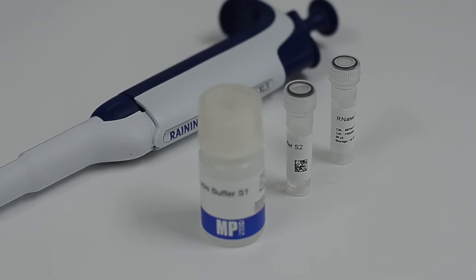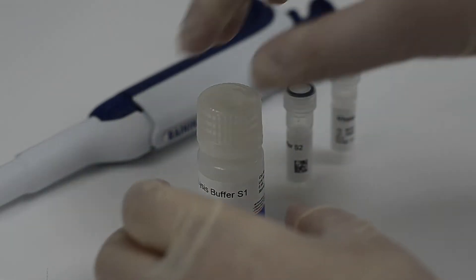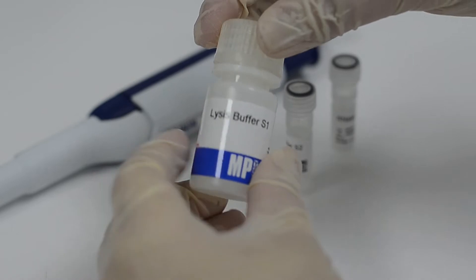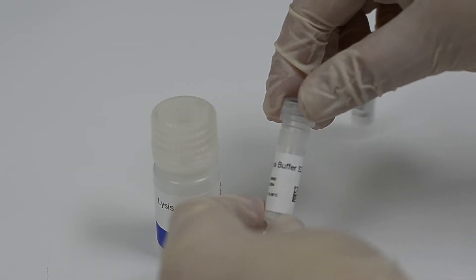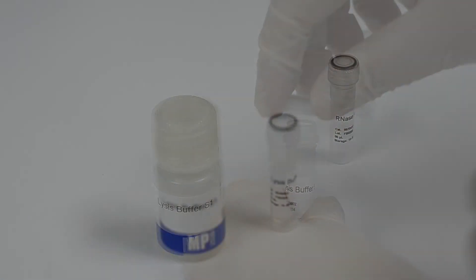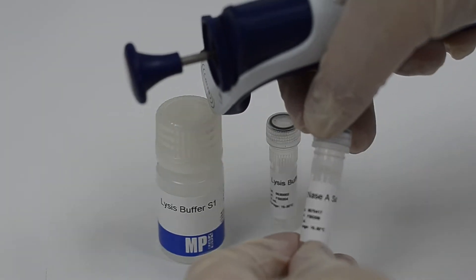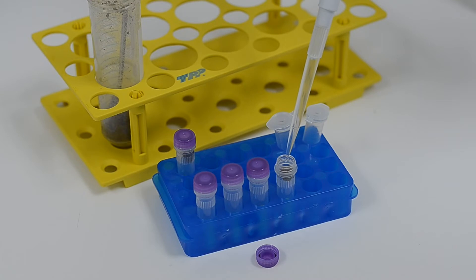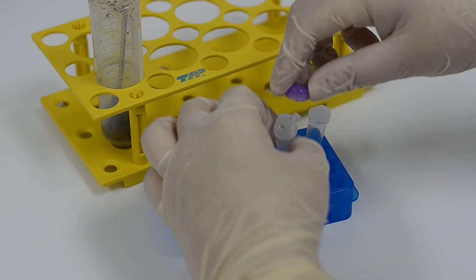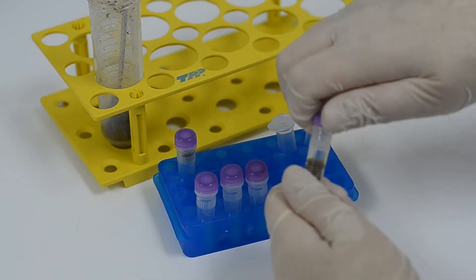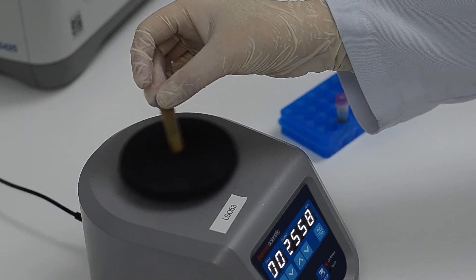Next, add the following buffer to the sample. Vortex the sample for 5 to 10 seconds to mix.